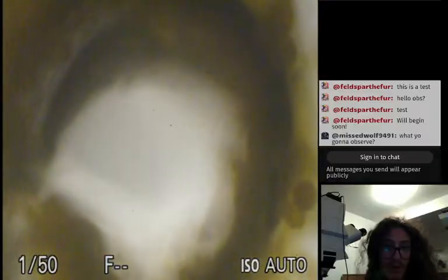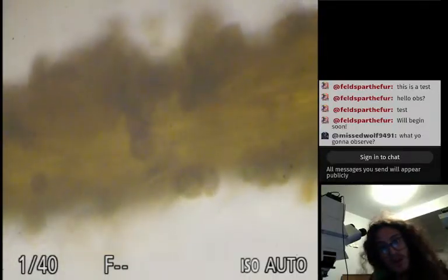Here we have the tip area. Wonder why it's built like that. Probably plant reproduction reasons. But that's a lot of pollen, and it's making me stress. There's a dot of it that's broken off. That's what it's meant to do. Be interesting to look at a bee under here, but I'm not. One, I like bees, so I don't really want to kill one, and two, I'm too afraid of bees. Priorities.